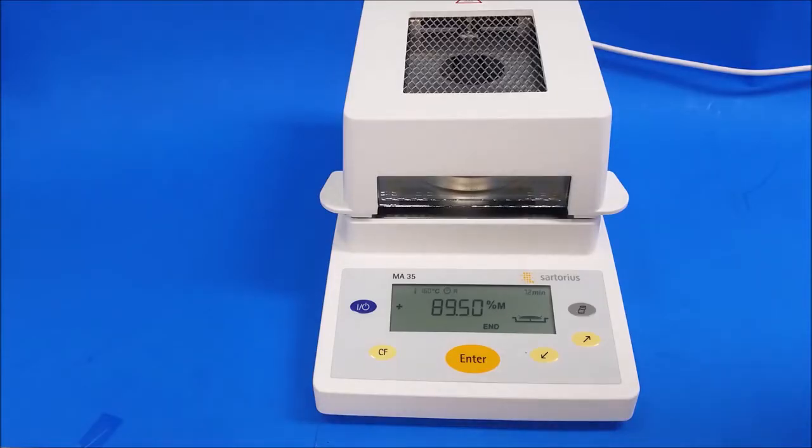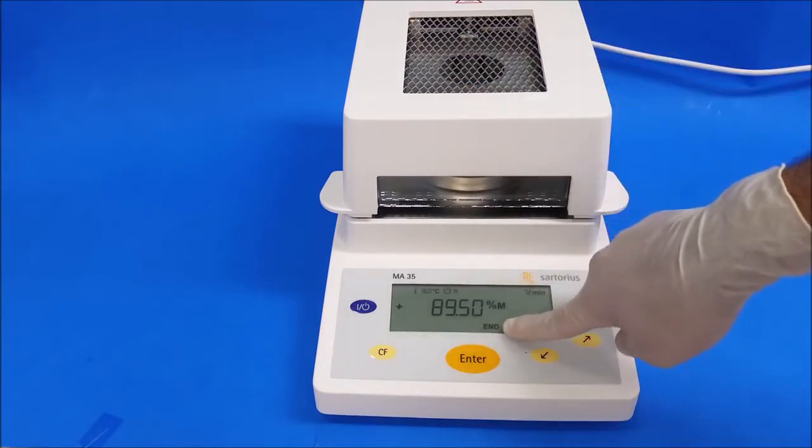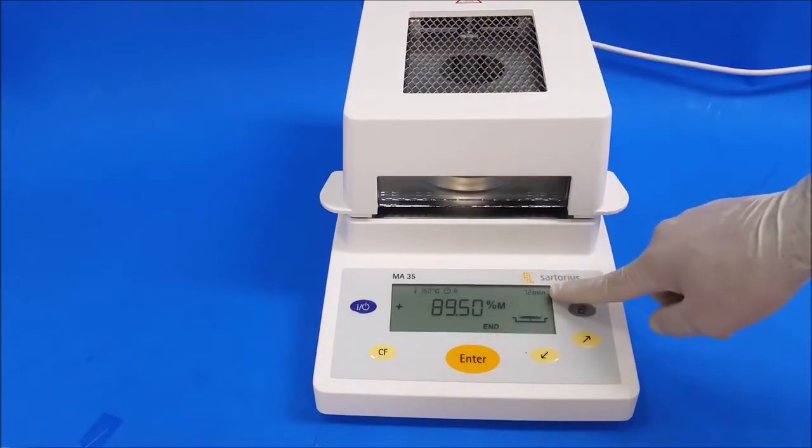All right, now that it's finished, it's going to give you a result. It's going to say end. That's when you know when it ends and the time how long it took.